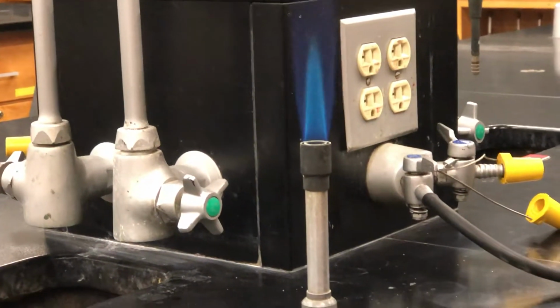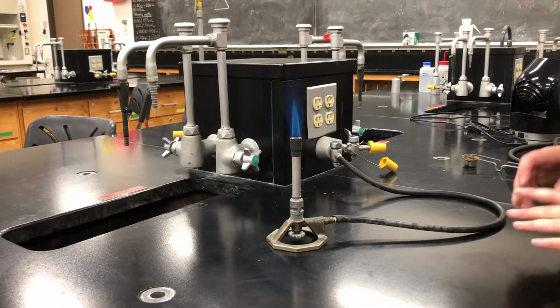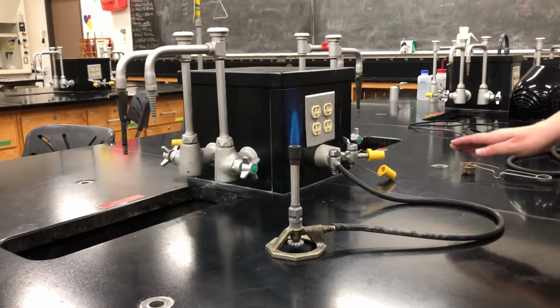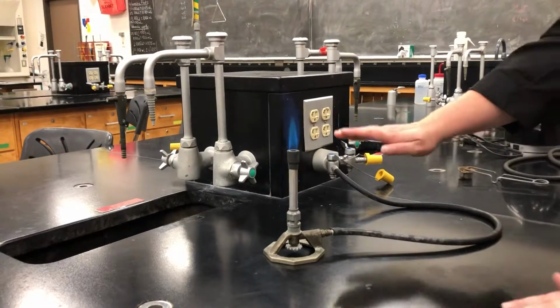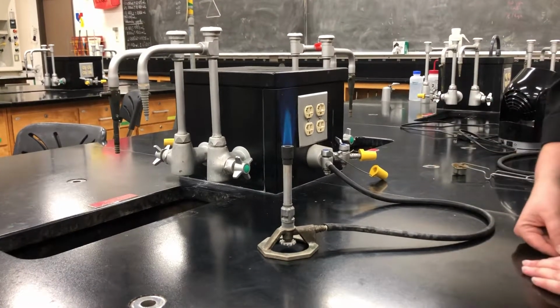Last thing we want to talk about is safety. Once you've lit a Bunsen burner, you never want to walk away from it. You also want to make sure that you're completely aware of it at all times. So when you're reaching around it and doing the rest of your reaction, make sure that you don't knock it over and make sure you don't catch your sleeves on fire.